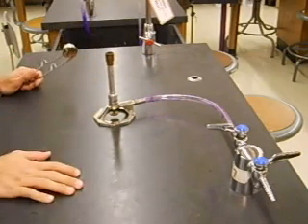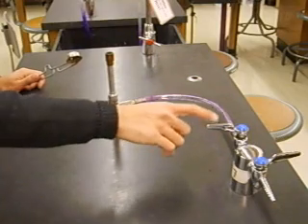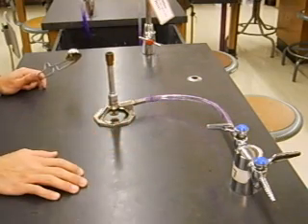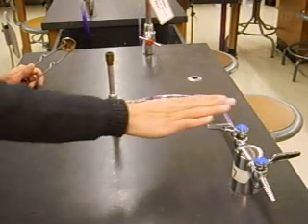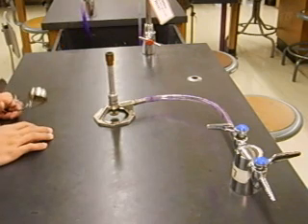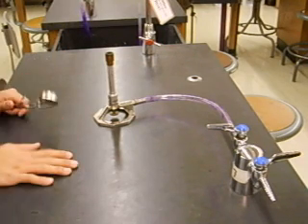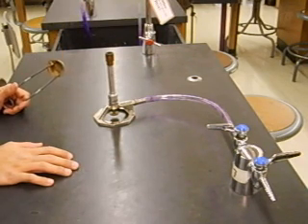In order to light the Bunsen burner, it turns out that you don't need to turn the gas on all the way to get a flame. It's probably not a good idea anyway because if it's on full blast when you light it, it's going to be a big flame and you might end up scaring yourself or hurting yourself.